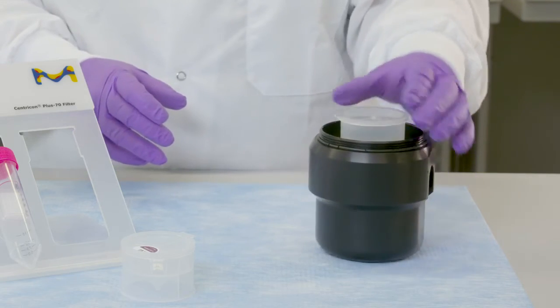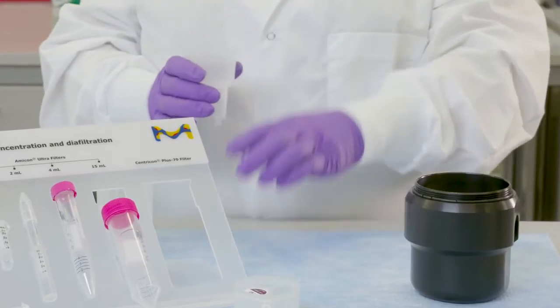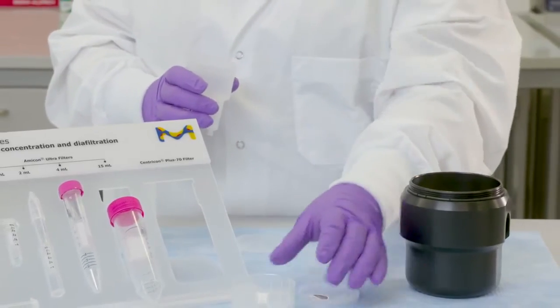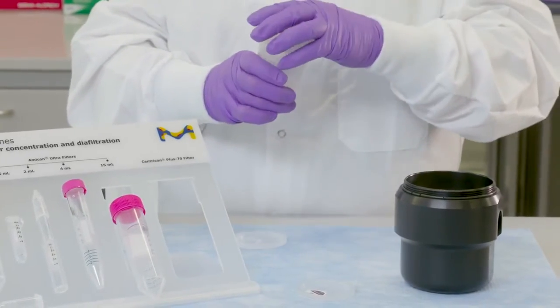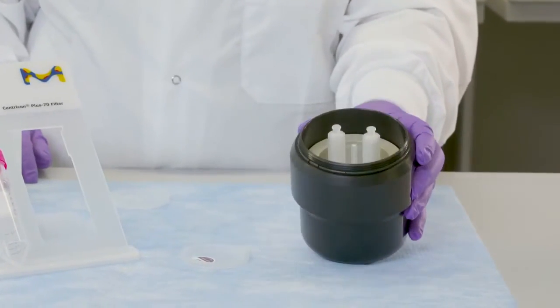For the reverse spin, the Retentate Recovery Sample Vial is attached to the filter device, inverted, and placed into the same swinging bucket rotor with a 250 mil bottle adapter. Orientation of the filter downspouts can be parallel to rotation.